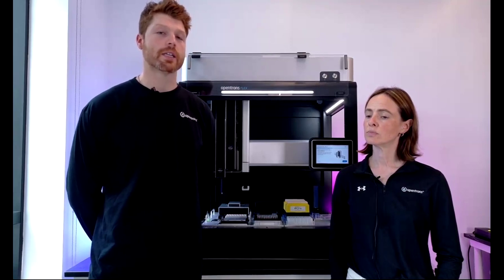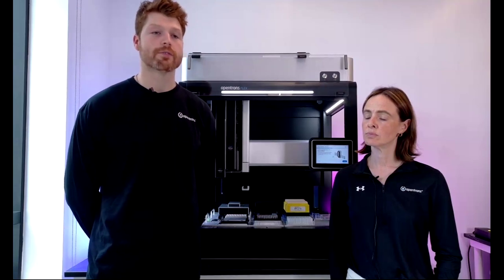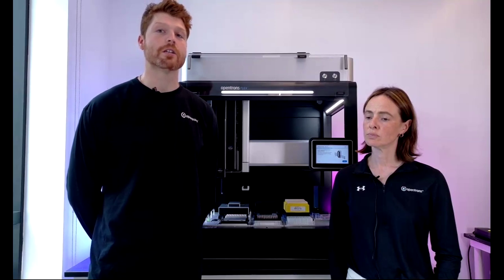So you don't even need to look at the measurements. You can just call them out by name. And through our UI tools like Protocol Designer, it's just drop-down menus of all of our supported labware, which is an even easier process if you want to author it that way.